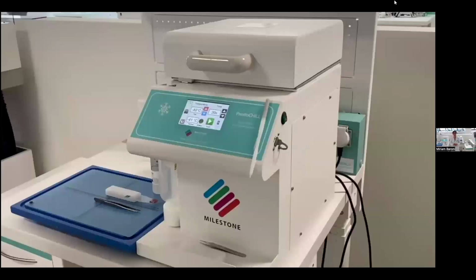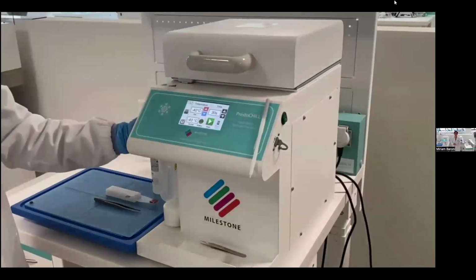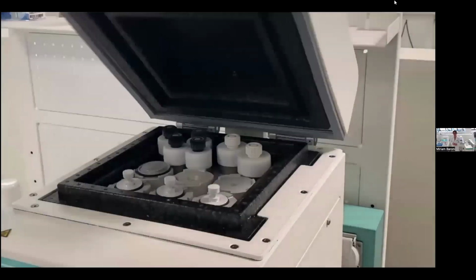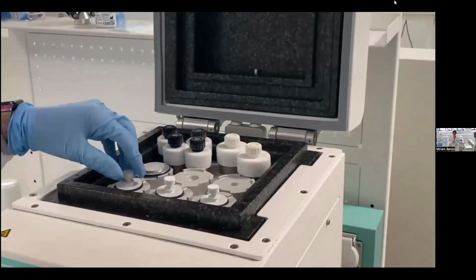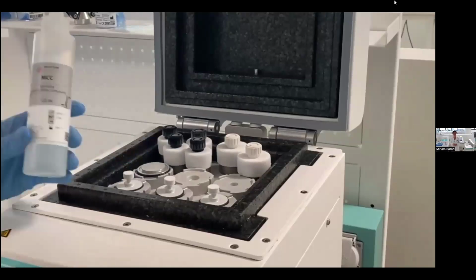Now, I will show you another short video that helped me show you our method to freeze a specimen. To improve the freezing quality, we have developed a new device that is called PrestoChill. This device has a working area with 6 metal molds at -40 degrees and allows to freeze the sample with a face down technique, like the procedure with the paraffin.